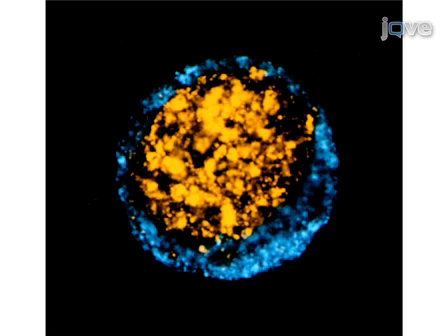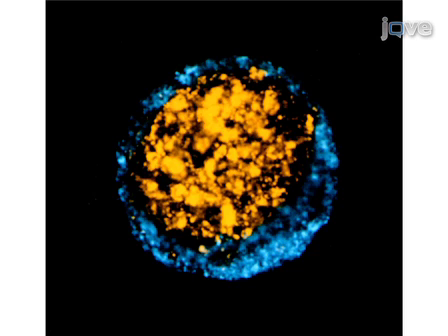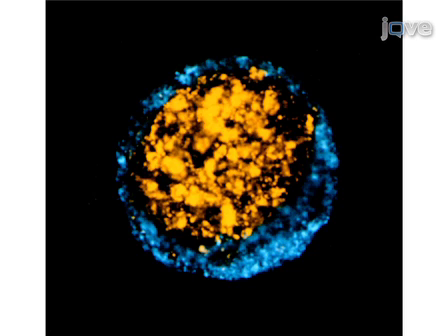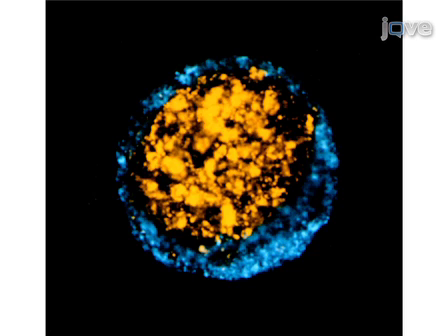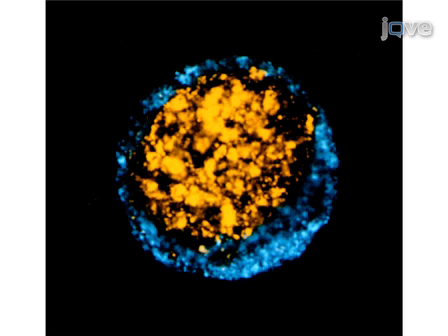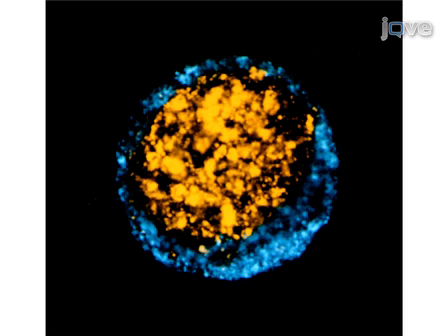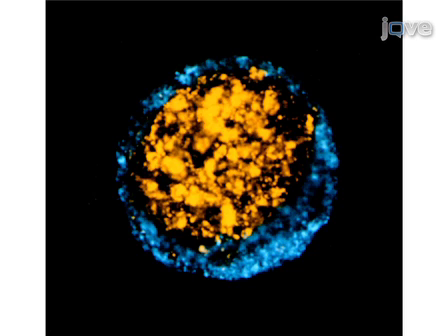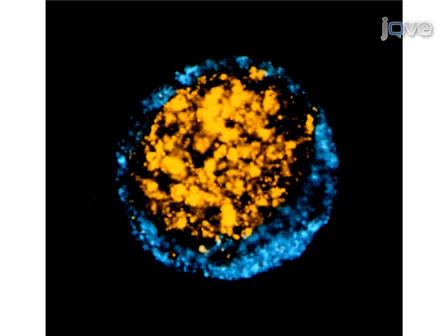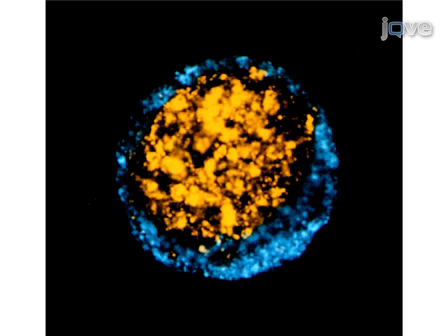Before proceeding to hanging drop culture, chick embryonic liver cells were stained with PKH2 membrane intercalating dye and chick embryonic heart cells were stained with PKH26. The cell suspensions were then mixed and hanging drop culture was performed for 18 hours, followed by 48 hours of incubation in the 37°C shaking water bath.